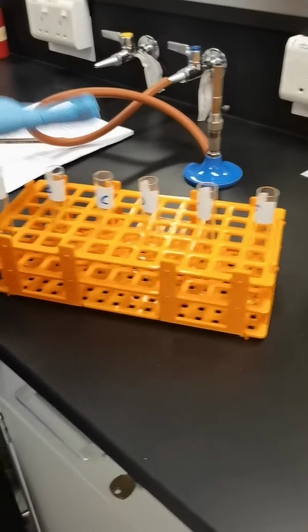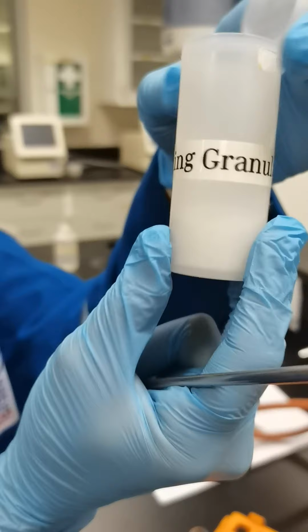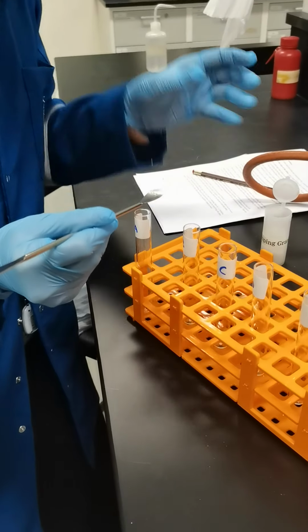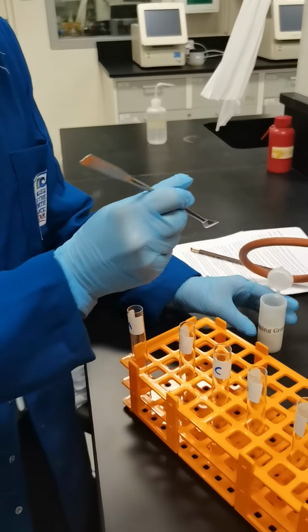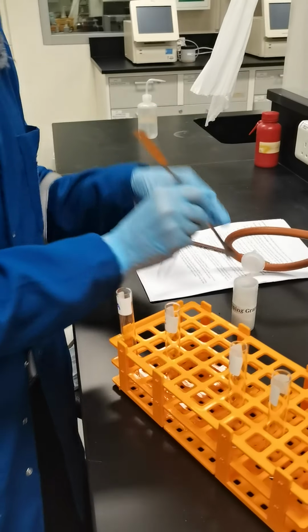And in these test tubes, I am going to add boiling chips first. Show me. What is it? This is the anti-bumping granules. It allows the liquid to boil without bumping. So I am adding this, which will never react and will never be included in the reaction. It will stay like that.